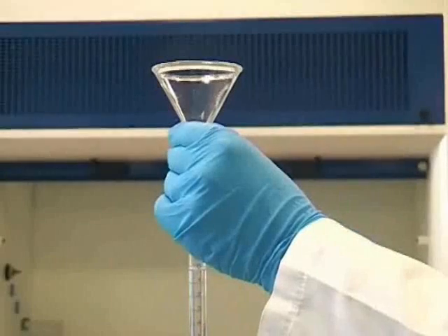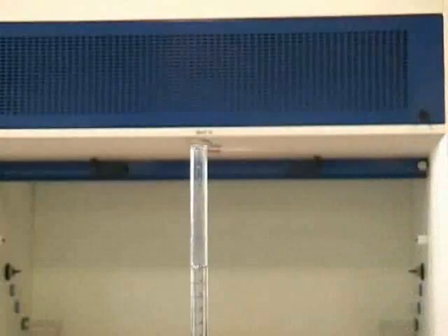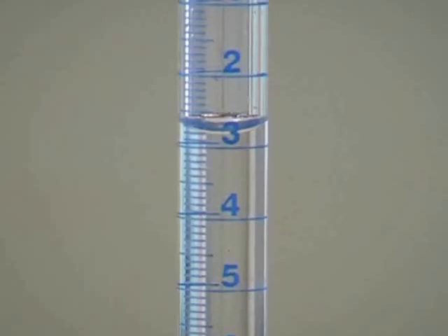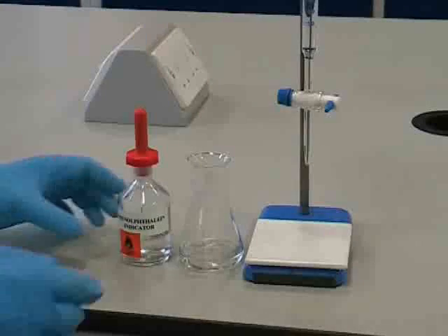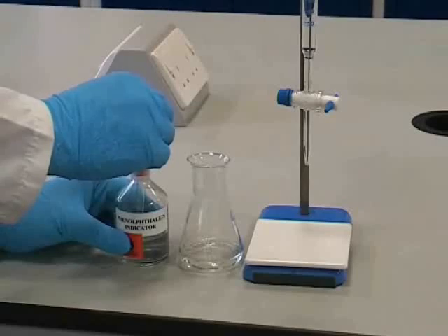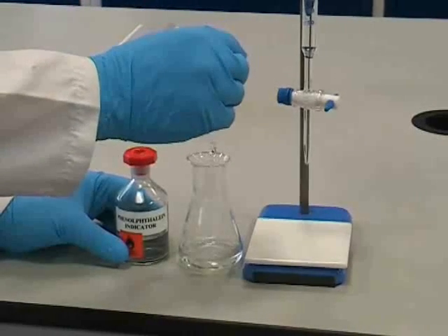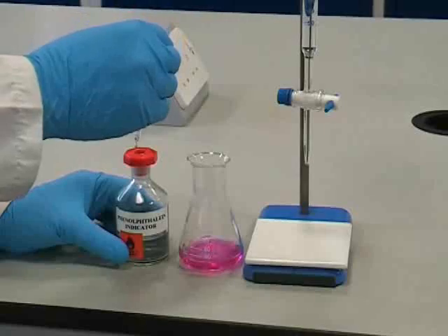It's not essential to fill the burette to the zero line, although you must make a note of the burette reading for later on. Before carrying out the titration, we need to add a few drops of indicator, which in this case is phenolphthalein. It's important not to add more than two or three drops of indicator as you don't need it.